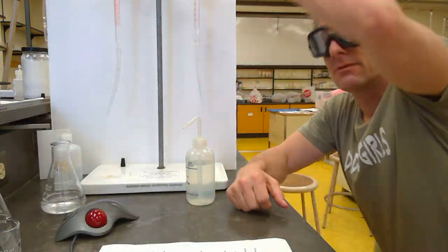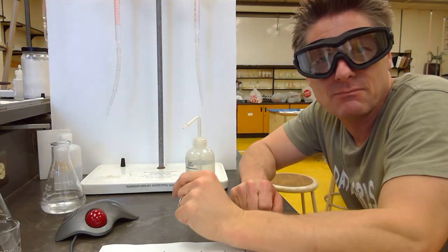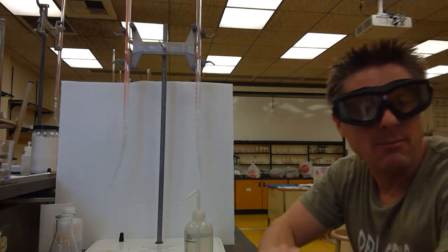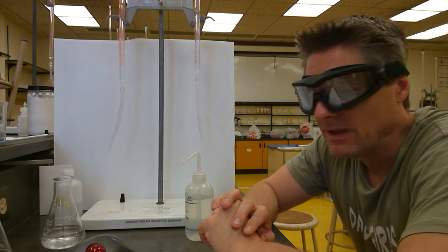And when you're all done, you refill the burette back up. The back titrant, you usually don't use more than a milliliter or two. So I only fill it up maybe 15 milliliters. So it's not nearly as full. I have it only filled up to here. Whereas the base titrant, you have to fill all the way back up close to the top. Doesn't have to be 0.00. Just get it up there.